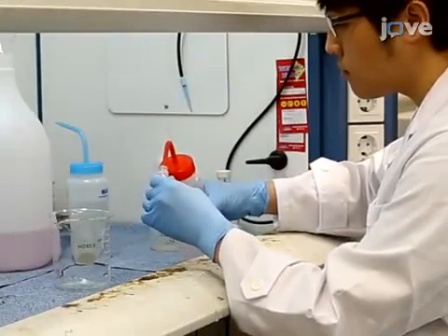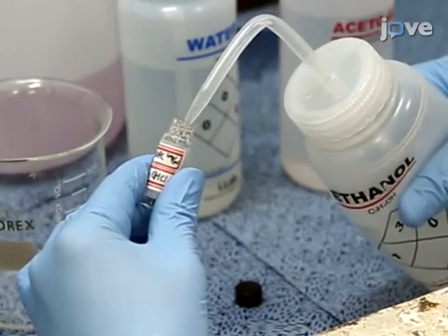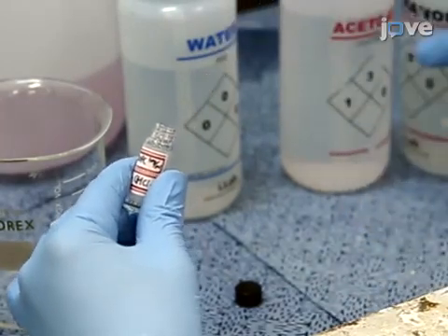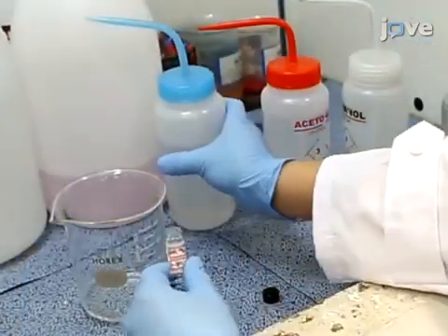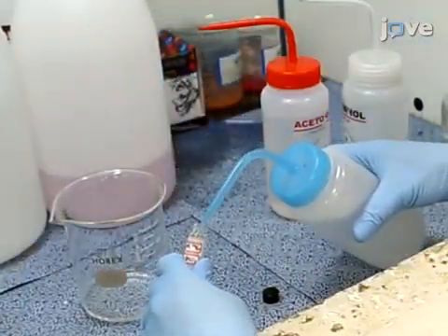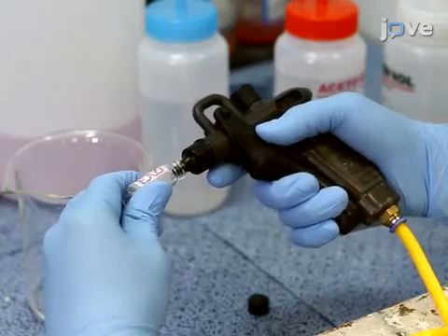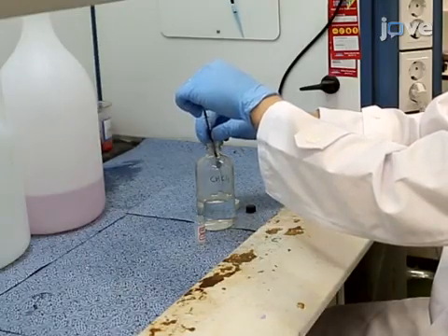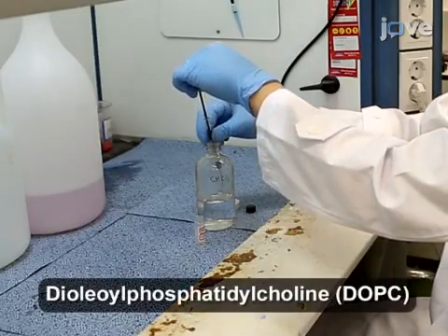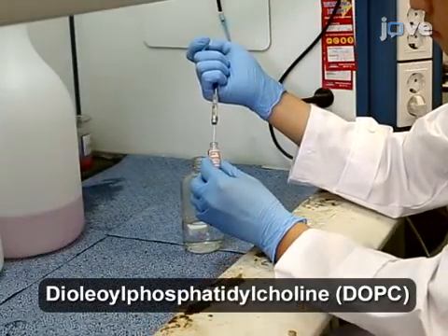To form a phospholipid monolayer, first prepare a phospholipid solution by cleaning a 4 ml vial with a polytetrafluoroethylene-coated cap. Rinse with acetone, ethanol, and deionized water at least 3 times. Then, blow nitrogen gas thoroughly into the vial to get rid of the water. Dissolve 1 mg of phospholipid into 1 ml of chloroform in the vial to obtain a concentration of 1 mg per milliliter.